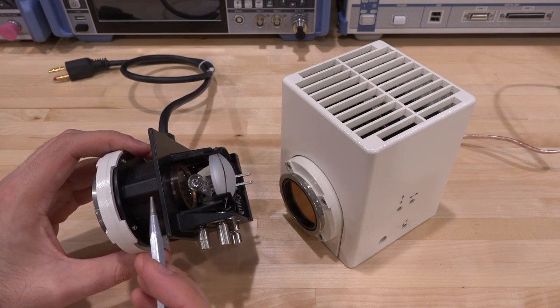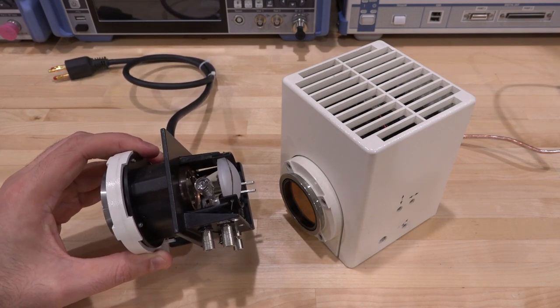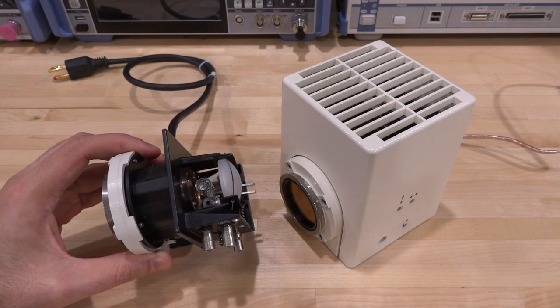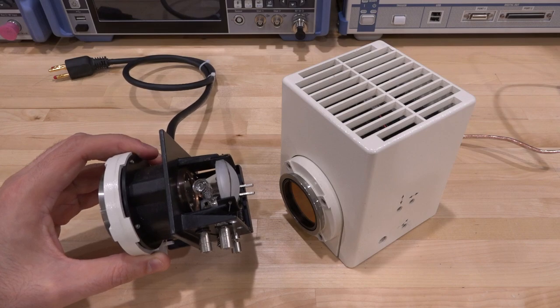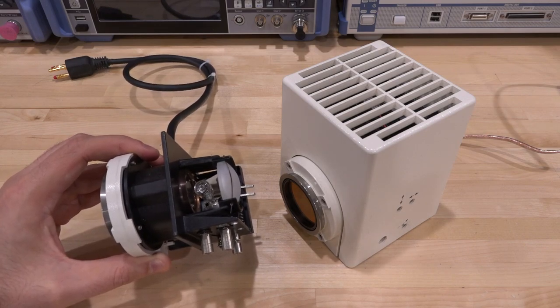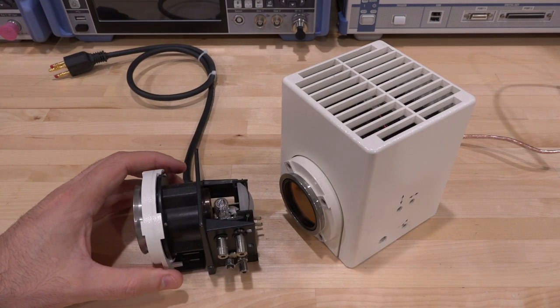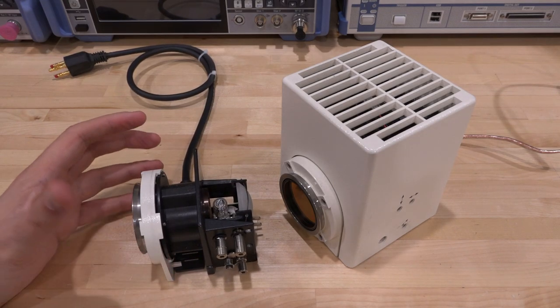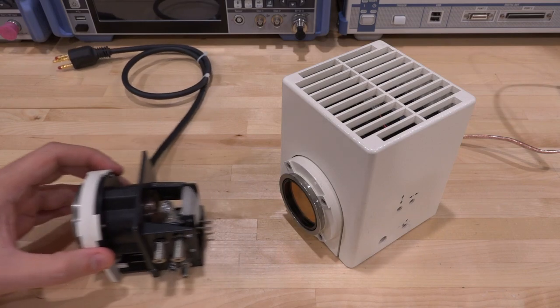So adjusting the intensity of the light changes the color temperature, which for viewing samples on a microscope is quite inconvenient. And this is why microscopes have a lot of neutral density filters. So you should switch in filters as opposed to attenuating this. But that can be annoying, as we will see. So that's why I wanted to have an LED light source with a good color rendering index, so that I just don't have to worry about that. You can dim an LED without changing its spectrum very much at all.